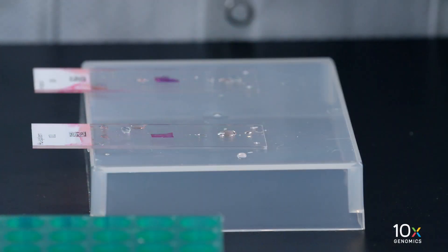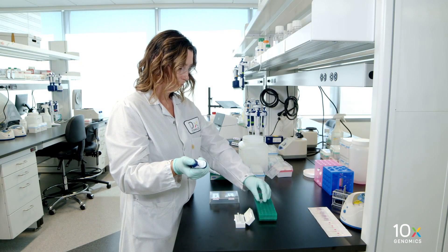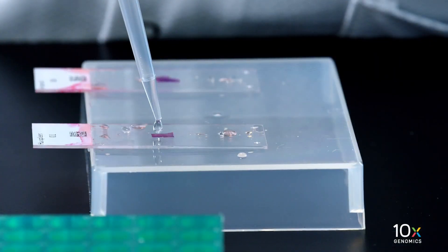Place the slides on a flat, clean, non-absorbent work surface. Some residual droplets may remain. Using a wide-bore pipette tip, add 100 microliters of mounting medium to uniformly cover all tissue sections on the slide.